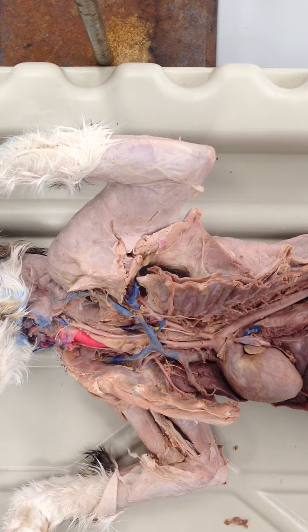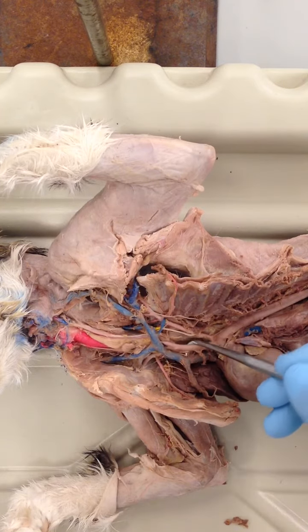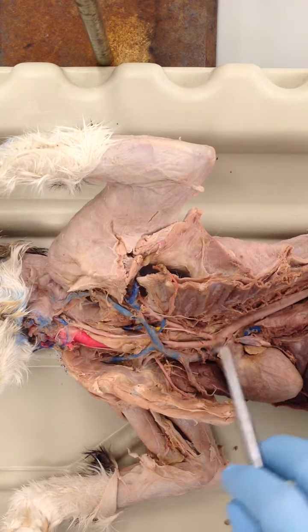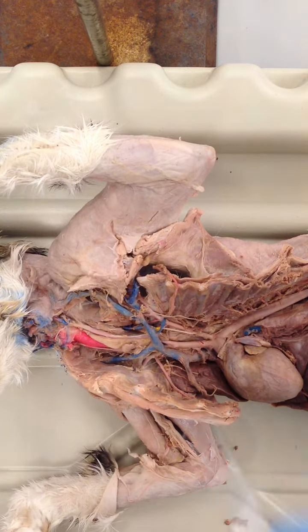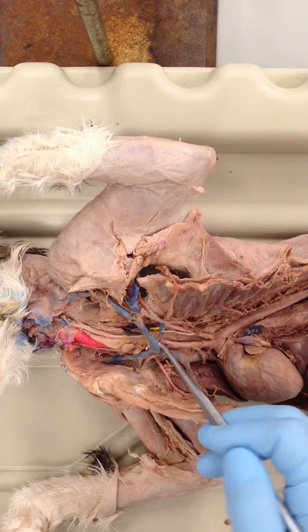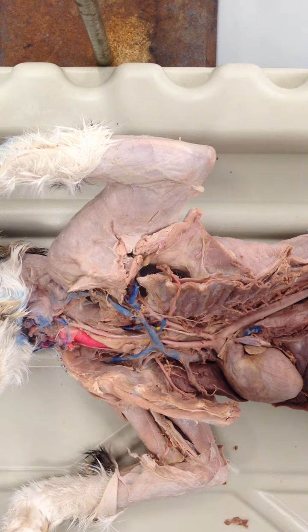Do note these cats have vessels that have been injected with colored plastic. The blue color is veins, and the red or light pink color are the arteries. Note that the colors in the arteries are not as bright because the walls of the arteries are thicker than the walls of the veins, so you can see much more blue color in the veins versus the arteries. Also, these cats are triple injected, and we'll see this when we get to the thoracic region, that the hepatic portal system is colored yellow.